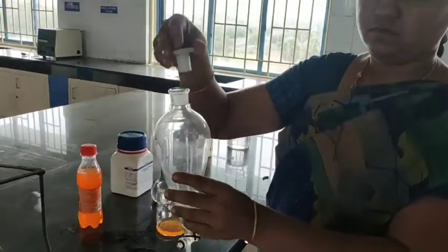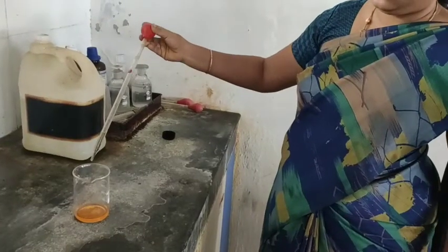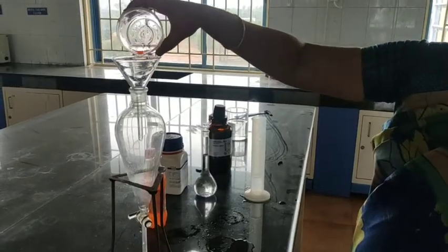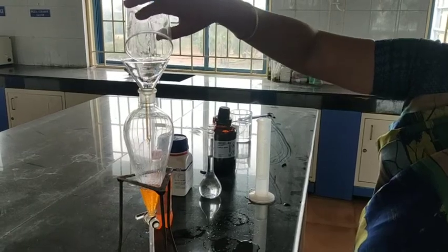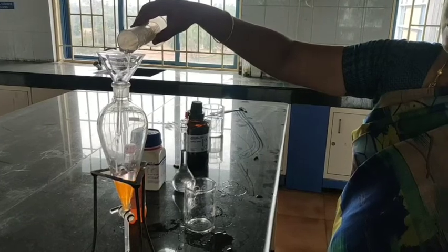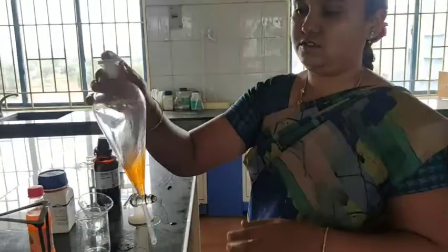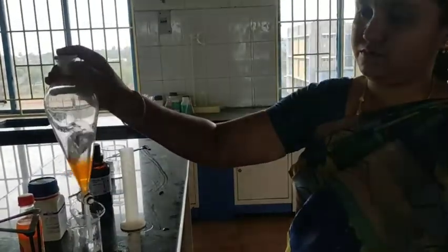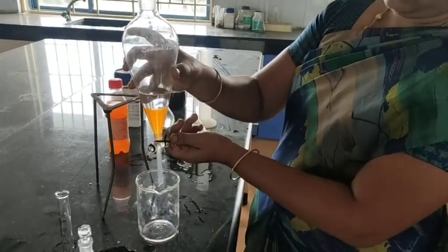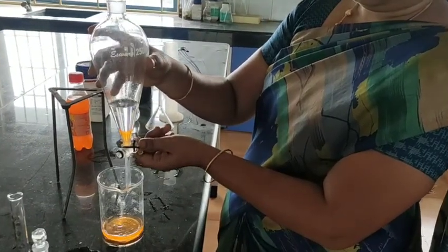We have to measure 10 ml of sample and add 2 ml of HCl to the sample. To extract using 25 ml diethyl ether, first we add the acidified sample into the separating funnel. Then 25 ml of diethyl ether is added and mixed well to facilitate the extraction, so whatever saccharin is present would get extracted into the diethyl ether.